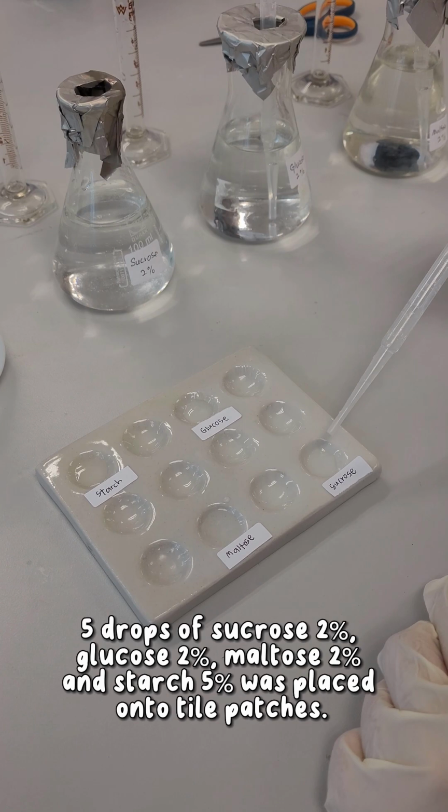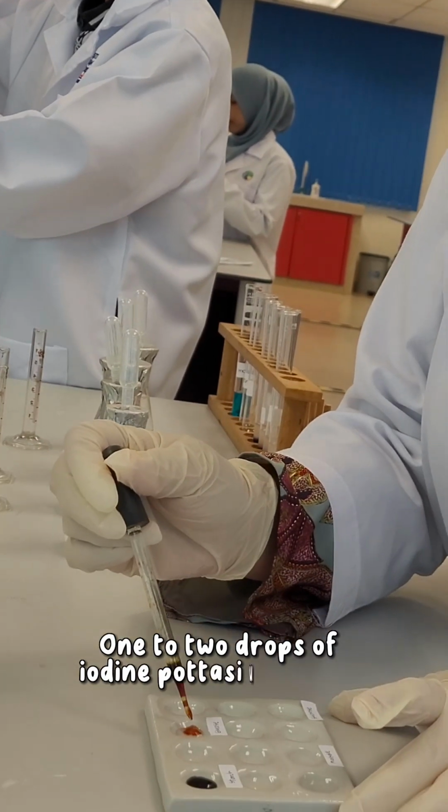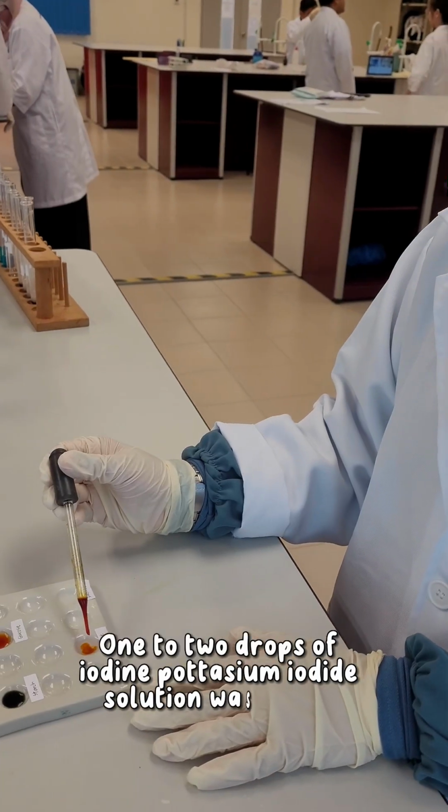For polysaccharide, firstly, 5 drops of sucrose 2%, glucose 2%, maltose 2% and starch 5% were placed onto tile patches. And then 1 to 2 drops of iodine potassium iodide solution were added.